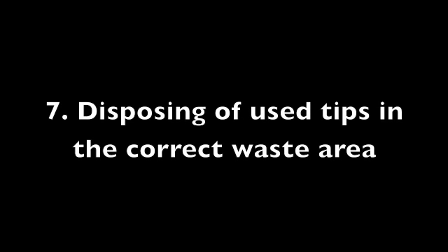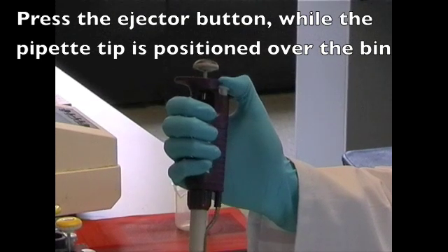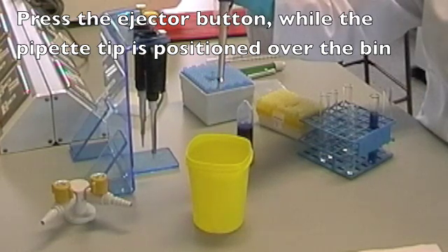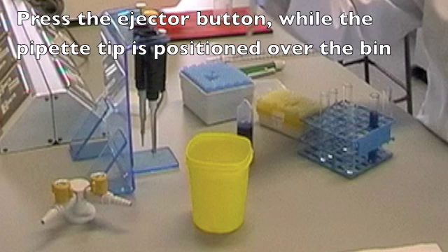Disposing of the tips in the correct waste receptacle is important, as a cluttered bench will lead to errors. Grasp the pipette firmly and press the grey ejector button located on the side of the pipette. Ensure the tip is pointing at the yellow bucket on your desk and press down on the button. After the class, you should empty the yellow bucket into the correct bin at the top of the lab.